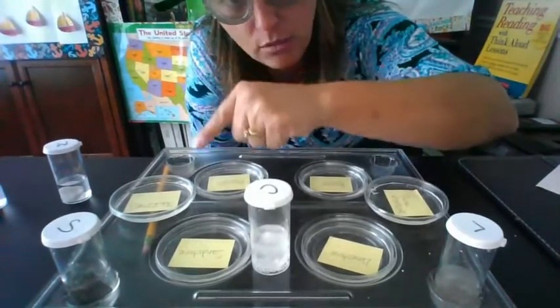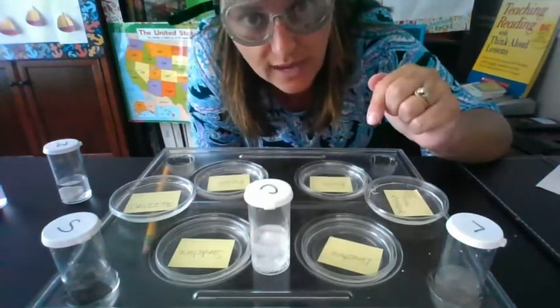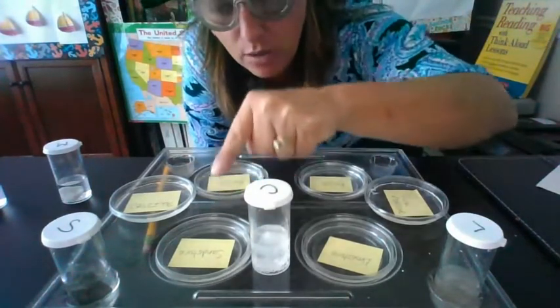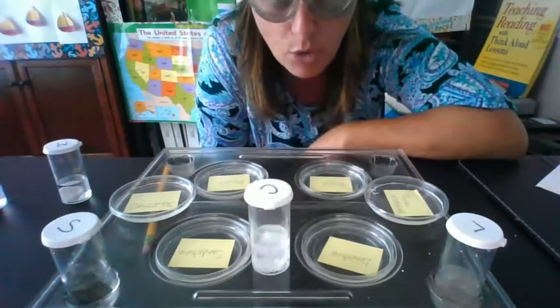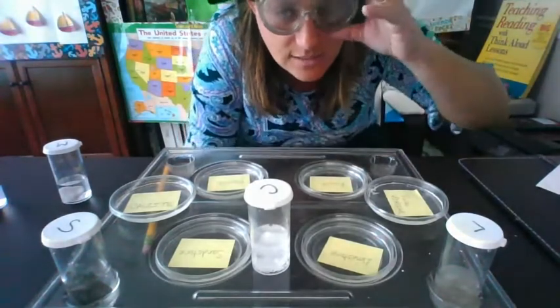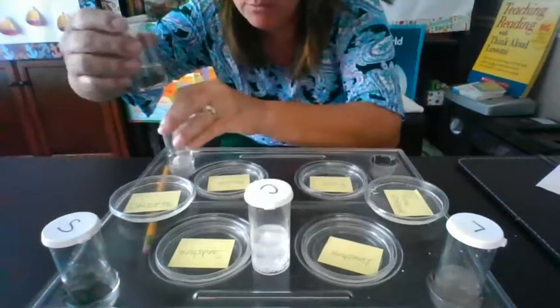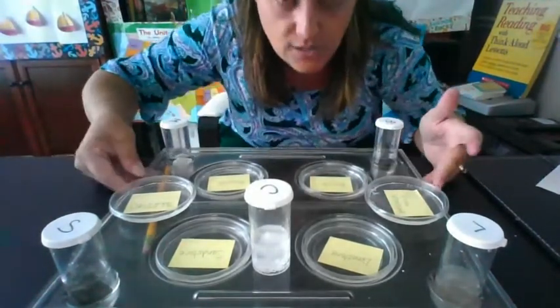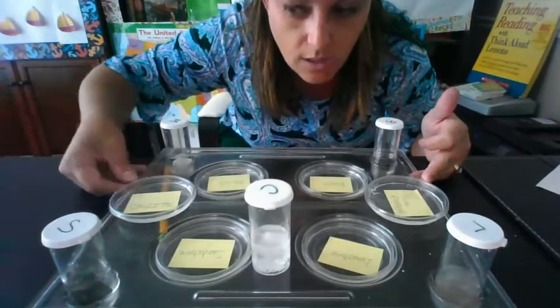So we're going to have to pay close attention to what the calcite crystals look like after the vinegar has evaporated, and we're going to compare those calcite crystals to our limestone, sandstone, basalt, and marble. And that, my friends, is going to give us our evidence as to whether or not there is calcite in any of those 4 rock samples.